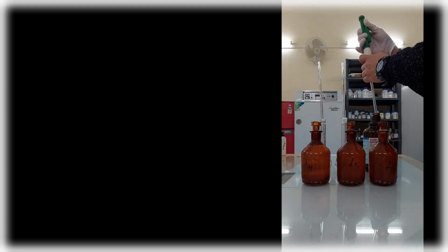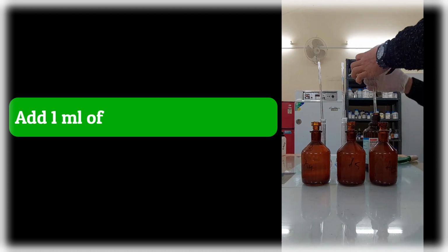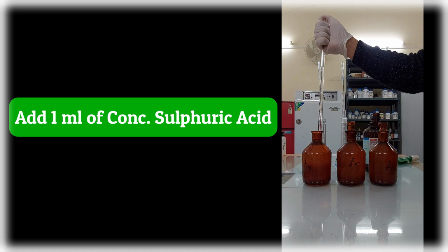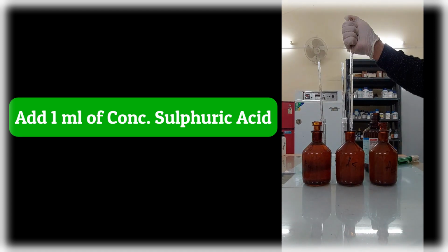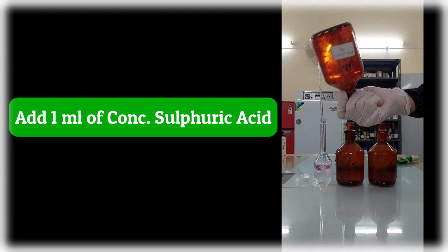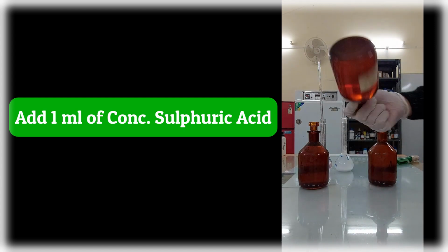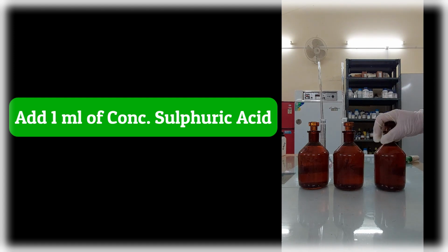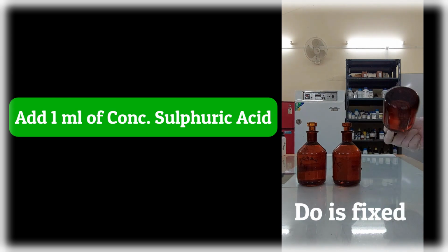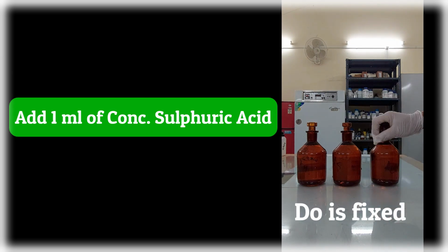Then to each BOD bottle you can add 1 ml of concentrated sulfuric acid. Invert the BOD bottles till the precipitate dissolves, and after this the DO present inside the BOD bottle is fixed.